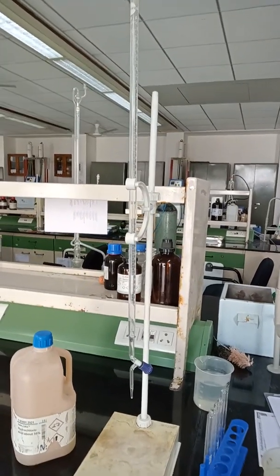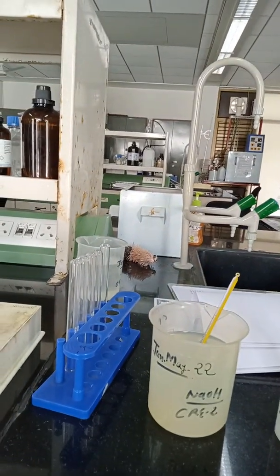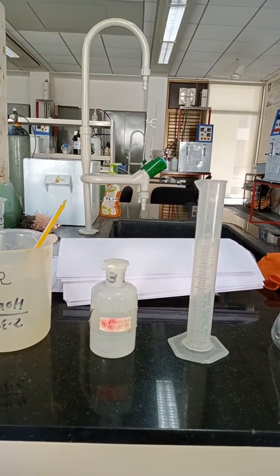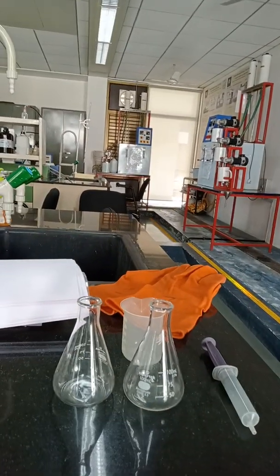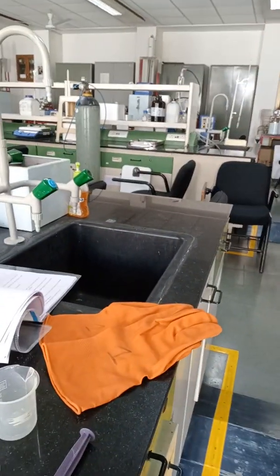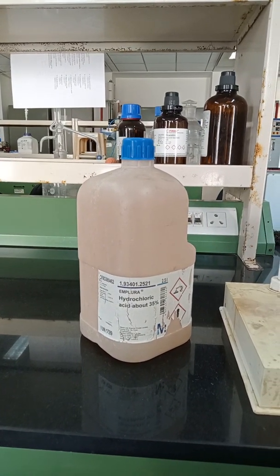Students, this is the glassware we require to conduct the experiment. We have the burette which has to be filled with NaOH of specified concentration, and test tubes to collect our samples. This is the NaOH to fill into the burette, and this is the phenolphthalein indicator for the acid-base titration. This is the measuring cylinder to measure the sample volume, and the conical flask for titration studies. This is the syringe to inject the tracer, which is HCl in our case, and these are the gloves to wear while handling acids and bases with utmost caution. This is the hydrochloric acid which we are going to use as a tracer.